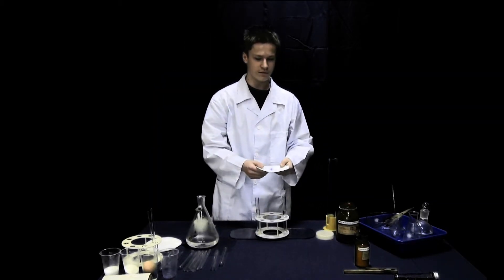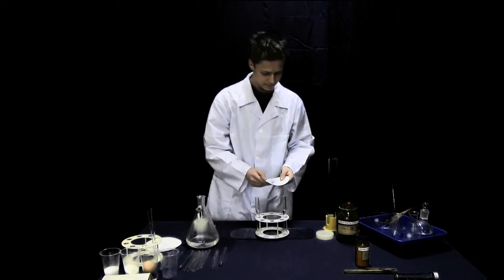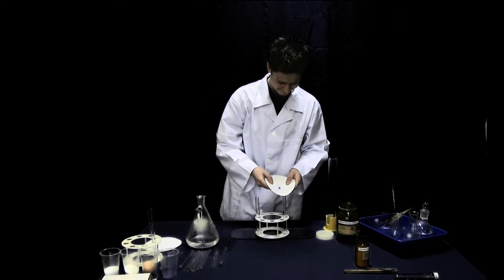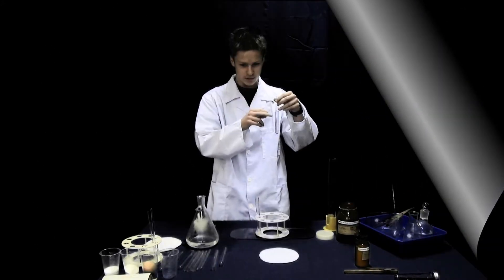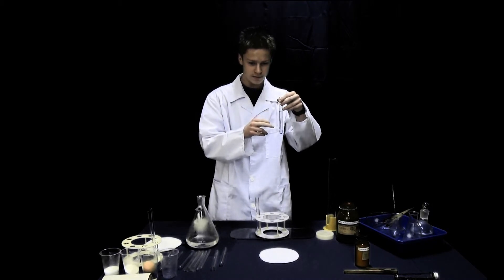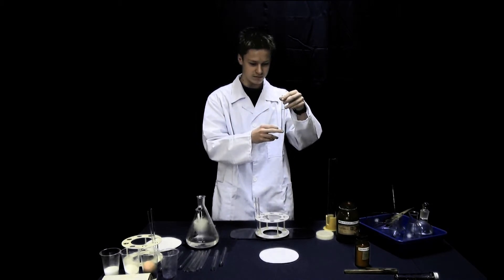Here I've got the crystal of copper sulphate. There is water in the tube and there is a crystal of copper sulphate at the bottom.